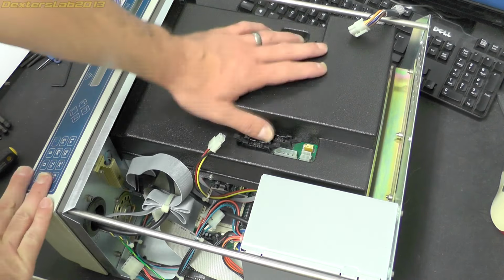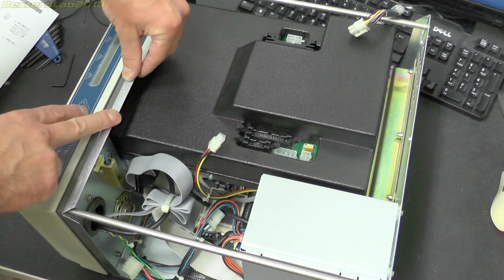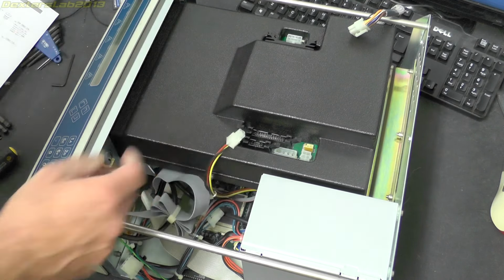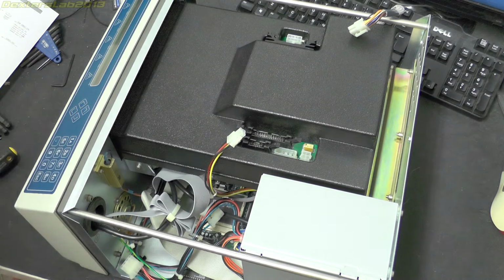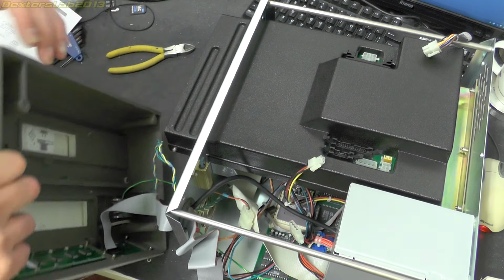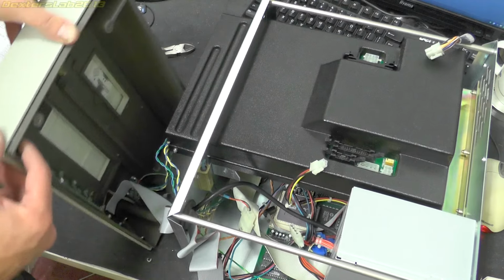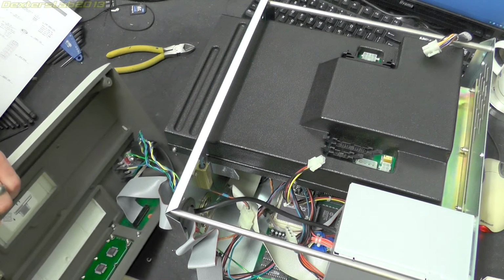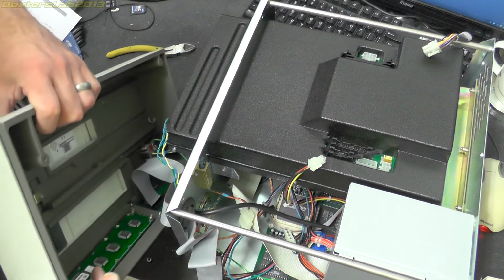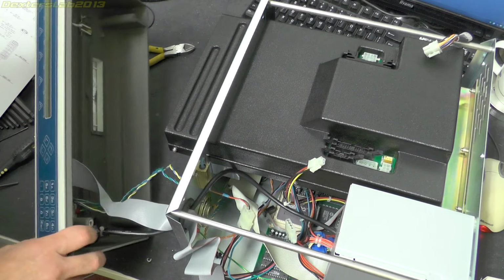Okay, it looks like I can't take this part out without taking the front panel off, because it runs through this metal part of the frame just here. So I think that I'm going to need to shuffle it around to actually get it out of there. So I'm going to take off the front panel and we'll see how we progress. Okay, well that's the front panel removed. I can't really get it all off because nothing's socketed. I'm just going to wait until this part comes off and then hopefully I can remove the rest of this. But on the underneath of here you've just got the ribbon cable comes up onto a PCB, and then it looks like you've got a standard Hitachi LCD just there. So maybe we can have a look at that when we get a bit further.